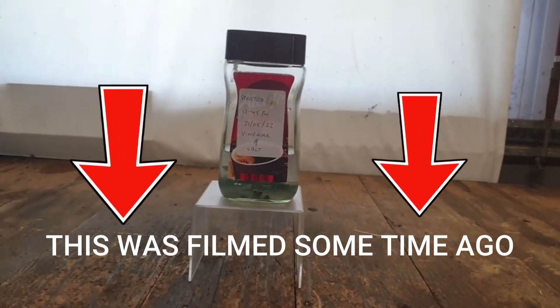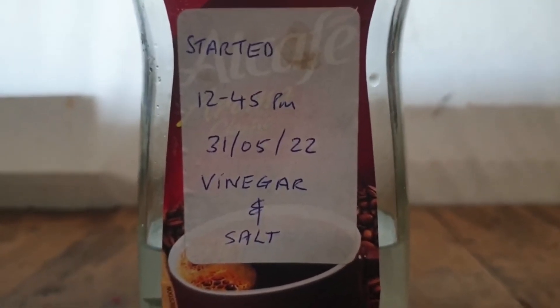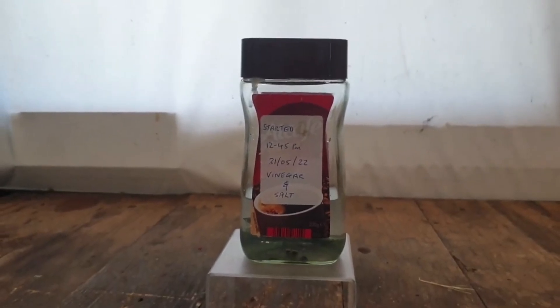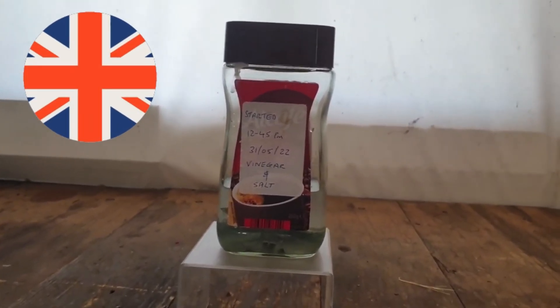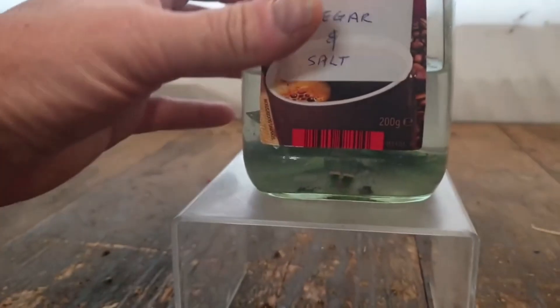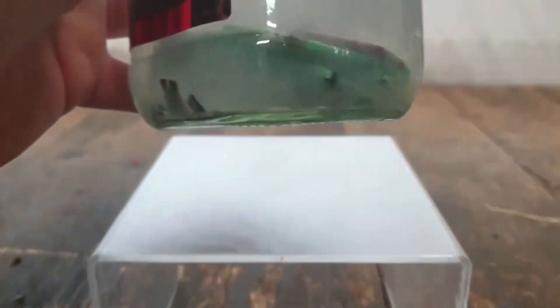It's the third of July. As you can see, I started this on the 31st of May — just over a month ago. This was inspired by a couple of guys over in the UK who do gold refining, and they used a vinegar and salt solution with some of the fingers. I thought, yeah, I'll give it a go.